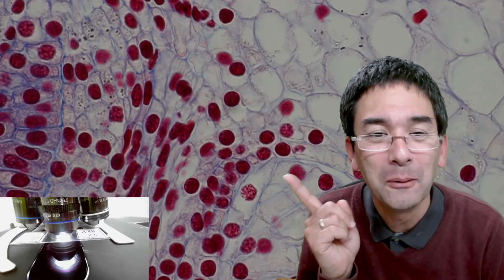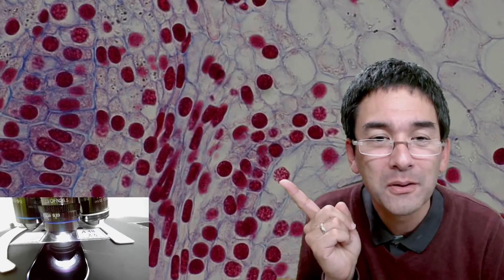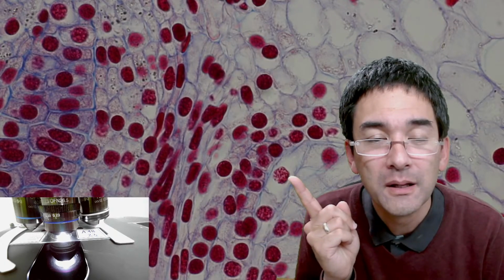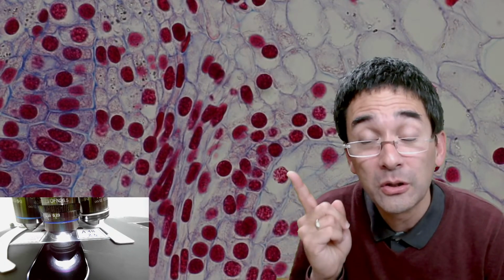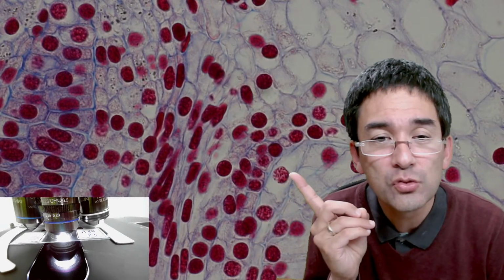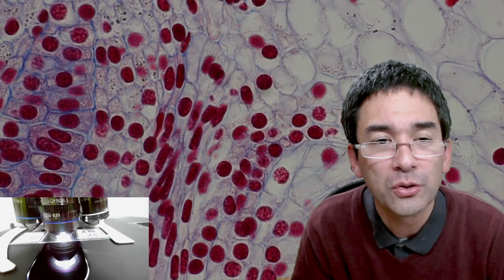Yeah, this one over here on the side, probably prophase. Okay, because you see that it's not quite as dark anymore. In prophase cells, this nucleus is slowly going to start to dissolve, and it's not quite as dark. So you are able to see the structure. It's kind of a little bit granulated. Yeah, so these are the individual chromosomes that now start to form.